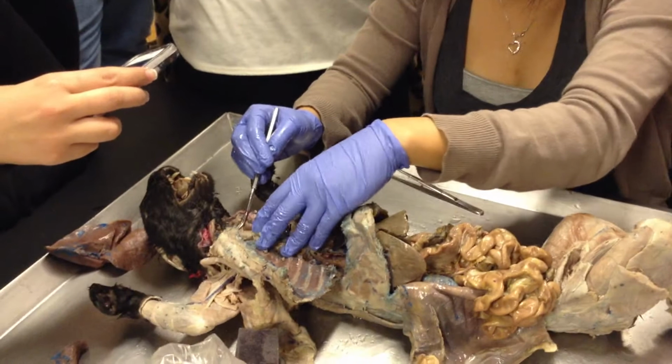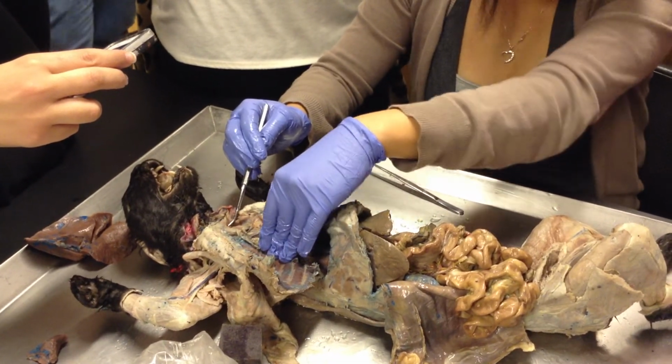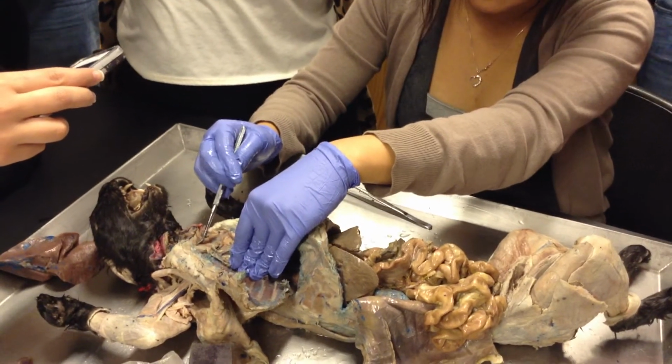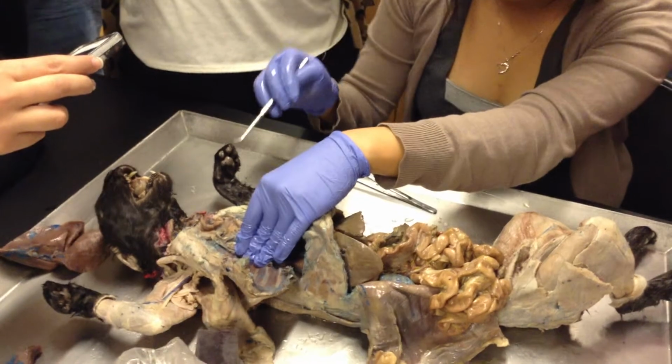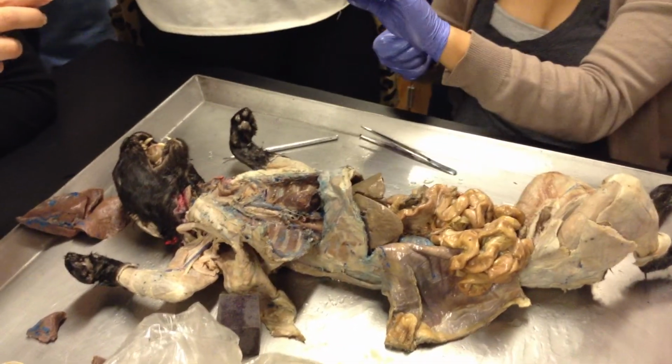Because that's very important. Do you guys remember the funnel-like passageway that connects specifically the nasal cavity to the throat? Nasopharynx. If it's specifically the nasal cavity, it's the nasopharynx. You can actually see it on the model, just in case it's on the exam. I'm gonna bring that out real quick.